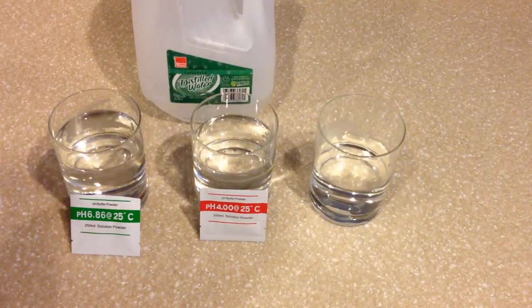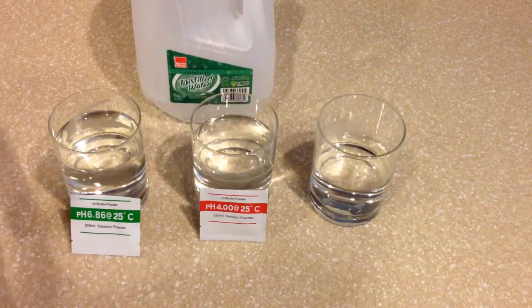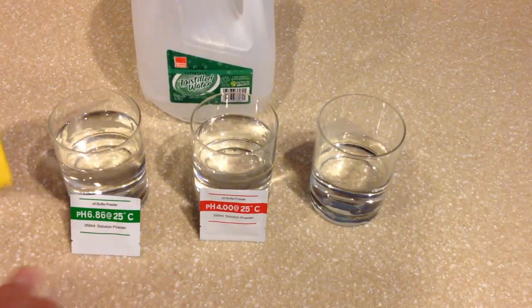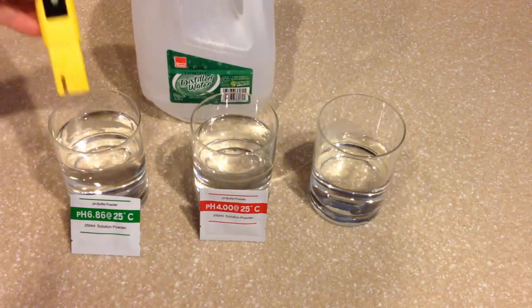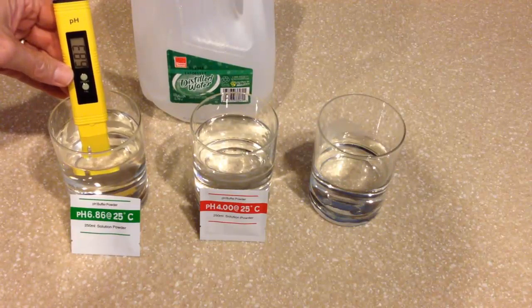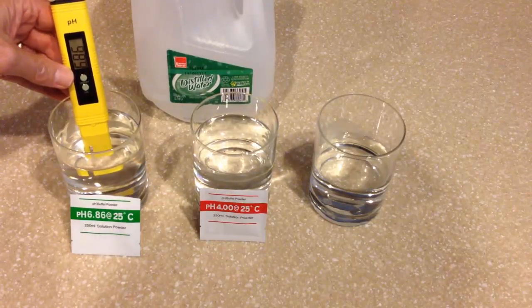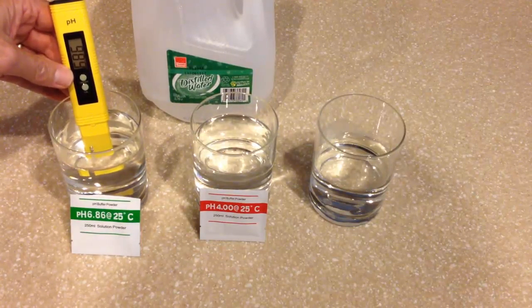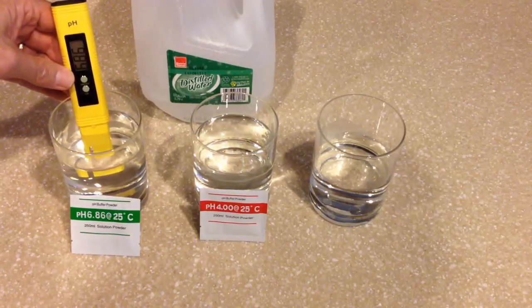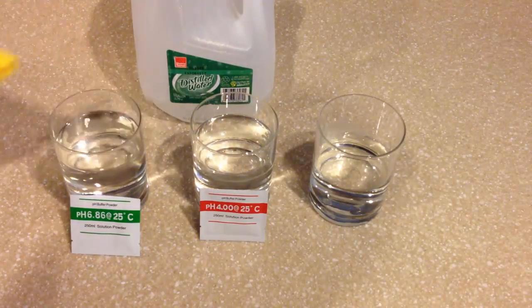It's that simple to calibrate. If you want to test it, you can simply put it back into the 6.86 solution without pressing any buttons and see what it reads. We'll just stick it back into the solution here, and let the reading hold. As you can see, it's reading 6.86, it's perfectly calibrated, it's that simple.